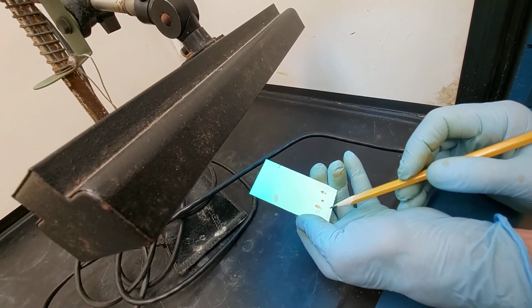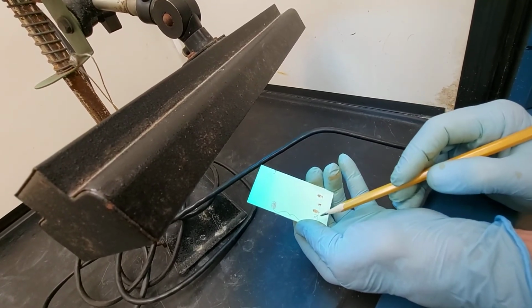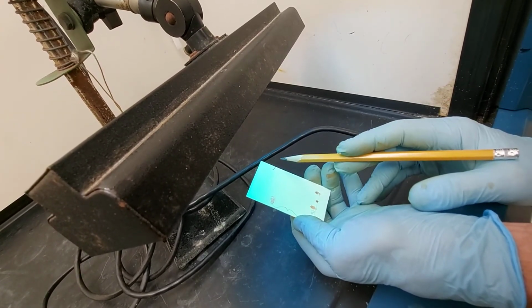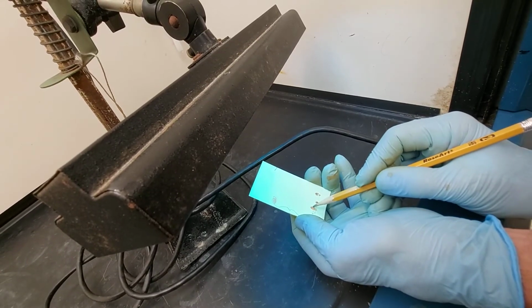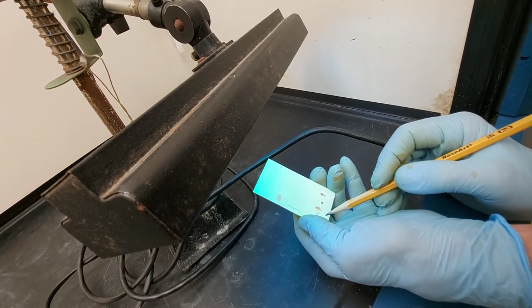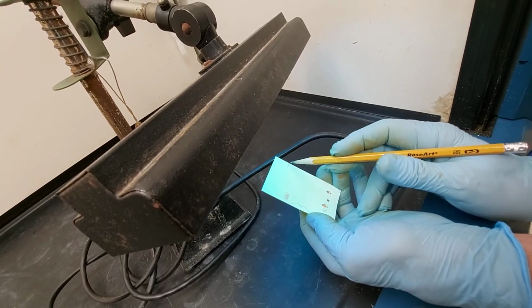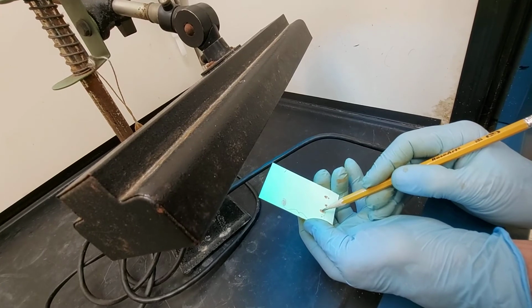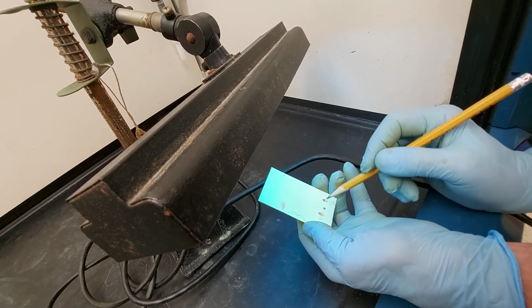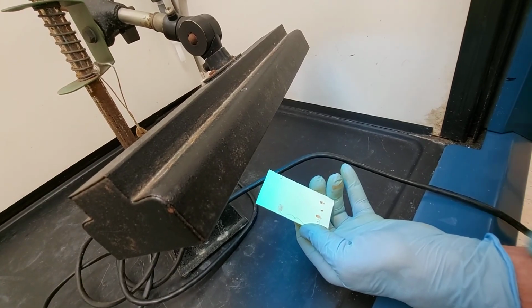So you're going to do calculations for ferrocene. So the middle of the spot from the origin is X divided by Y, which is the solvent. That's called the partition coefficient. And here, did I call it partition coefficient? That's the wrong name. It's retention factor, RF. It is X over Y for ferrocene, X over Y for acetylferrocene, and the small x, which is only like a couple millimeters, over Y for diacetylferrocene. And that concludes what we need to do for this experiment.